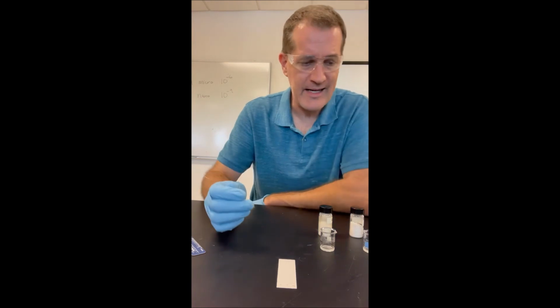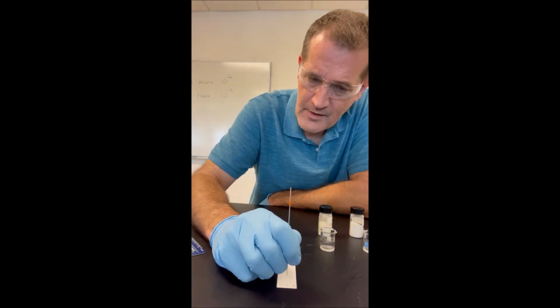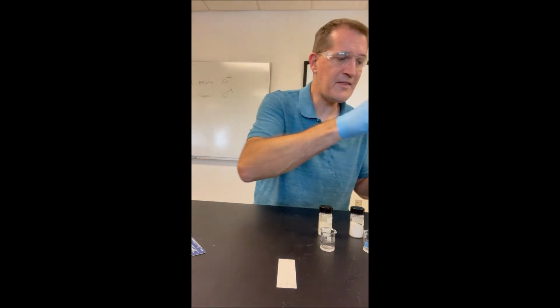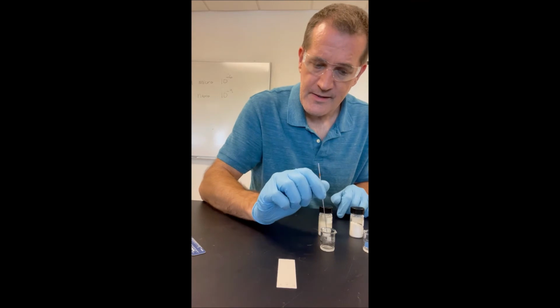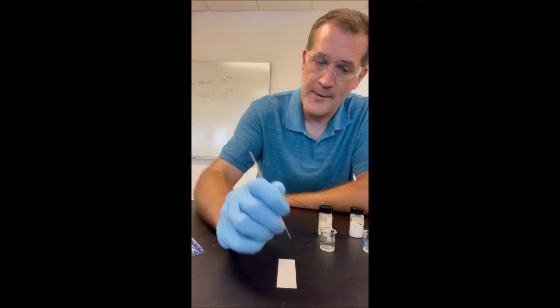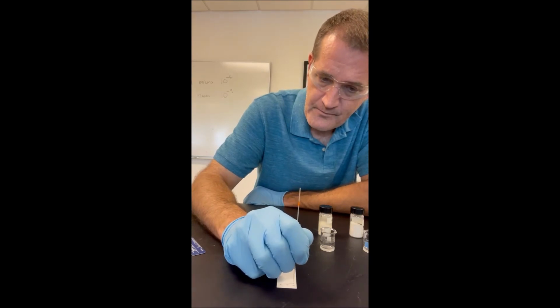All right, I did that for caffeine. I'm going to do exactly the same thing for Tylenol, and I'm going to spot it right on the line again. And I'm going to do the same for aspirin, and I'm going to spot my unknowns in exactly the same way. I'm not going to show a video for that because it's exactly the same as here.